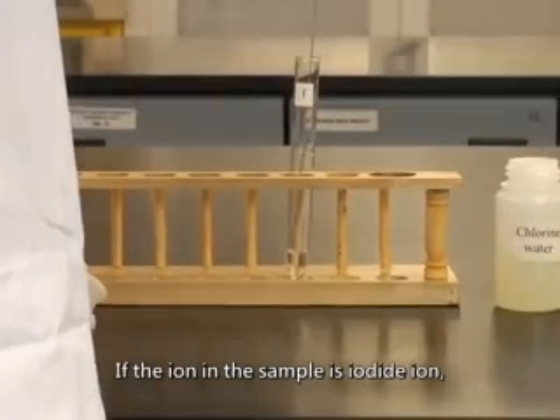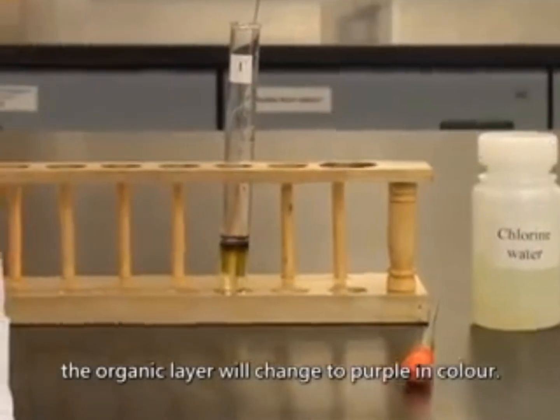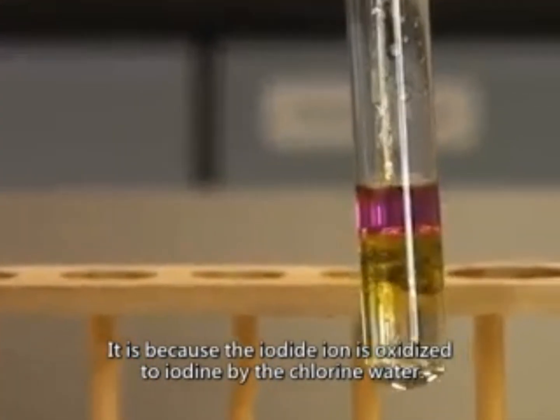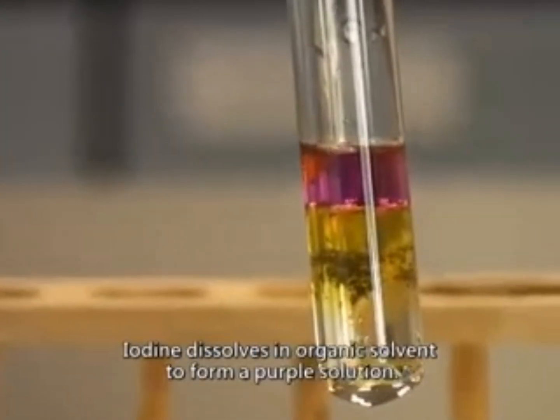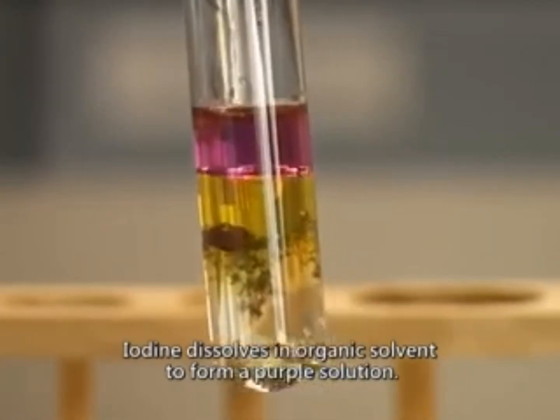If the ion in the sample is iodide ion, the organic layer will change to purple in color. It is because the iodide ion is oxidized to iodine by chlorine water. Iodine dissolved in organic solvent forms a purple solution.